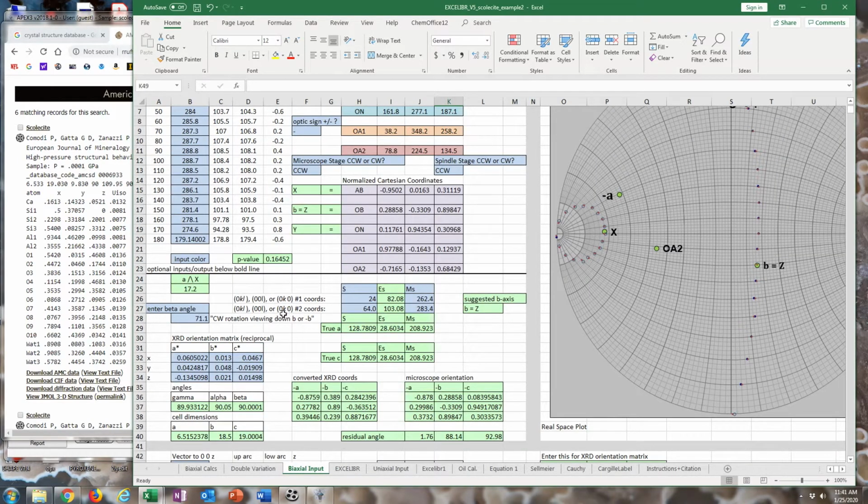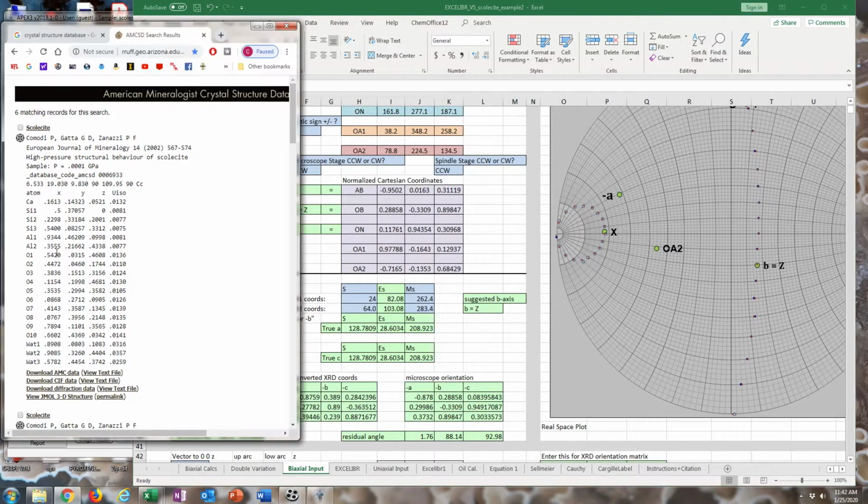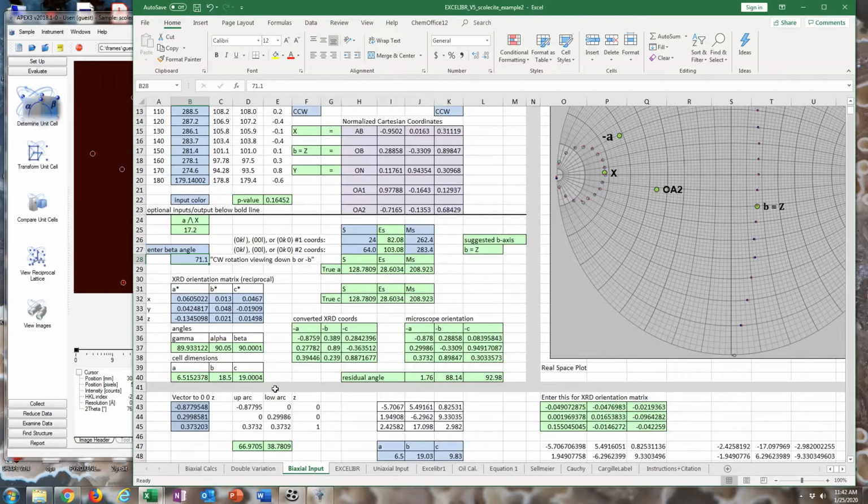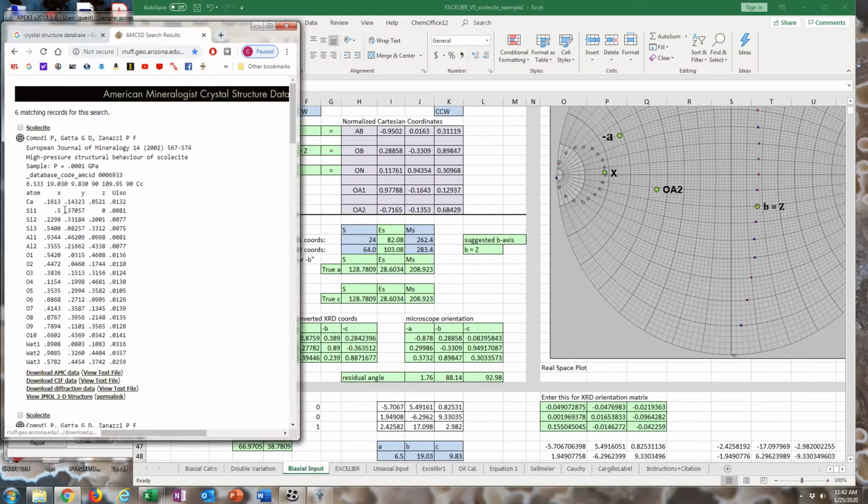Alright, so this is the correct spreadsheet to use. I found the A-axis, which was the long axis of the crystal in this example. Entered my beta angle, and I have my microscope orientation matrix. So if I want to use the microscope orientation matrix, I need to go down here. And notice that this is about a 110-degree beta angle. There's something unusual about the setting that was chosen for this publication as well, and we'll run into that later. But just to keep things consistent, we're going to use their setting.